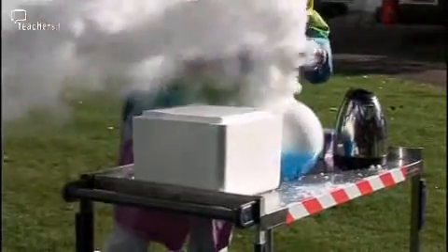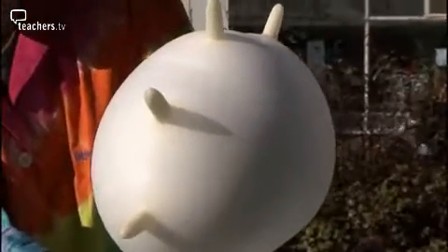The second thing we can do is put a glove on. Two handfuls of solids create a lot more gas. One mole of any gas occupies 22.4 litres, and we certainly put more than 44 grams in there. And bang, there it goes.